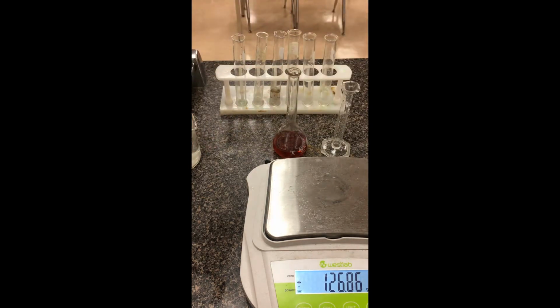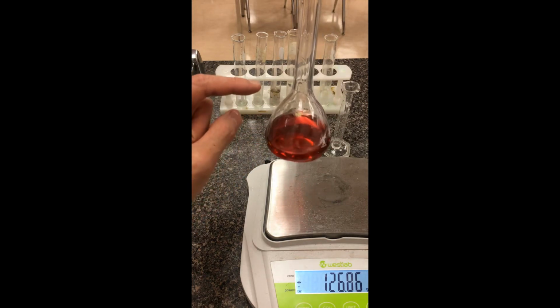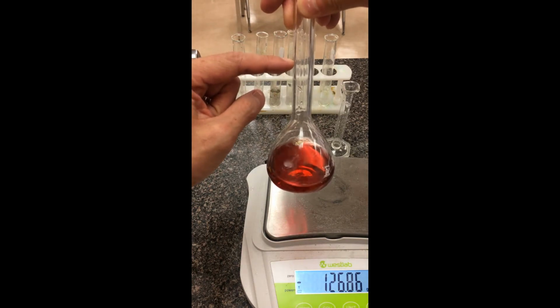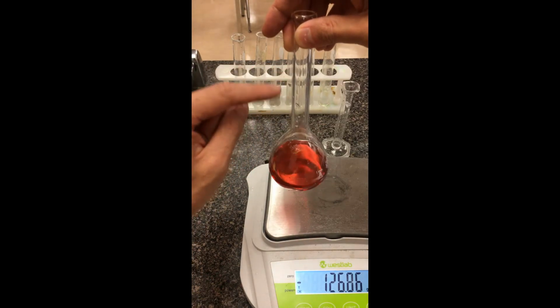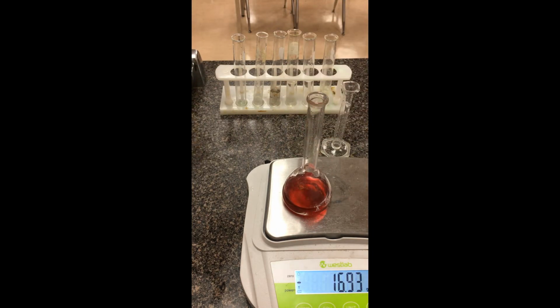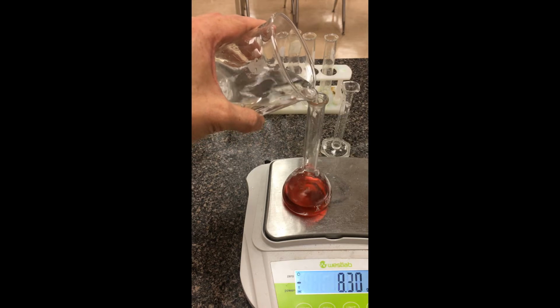And now what we're going to do is add water directly to the volumetric flask. Again, near the bottom here, you have a lot of wiggle room. By the time we get up to the narrow neck, you have one mark, really well calibrated for 100.00. When we get up to that neck portion, you might want to use an eyedropper at eye level, at the bottom of the meniscus, to get to that mark. So I'm just going to add a little bit of water. We don't really need to do this on the scale, but I'm just going to add it on there.